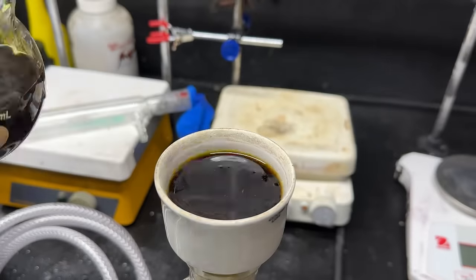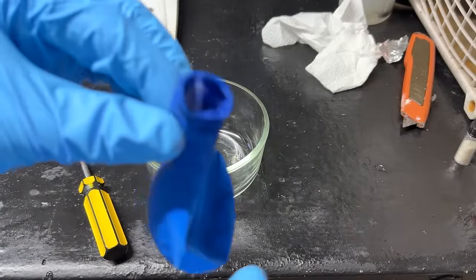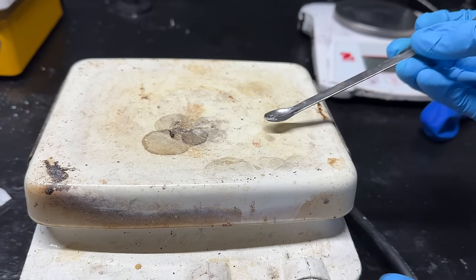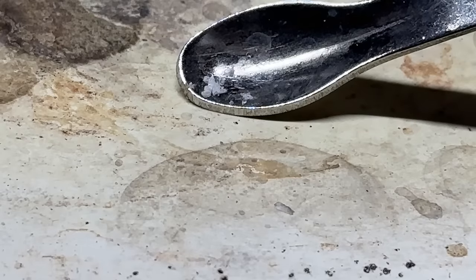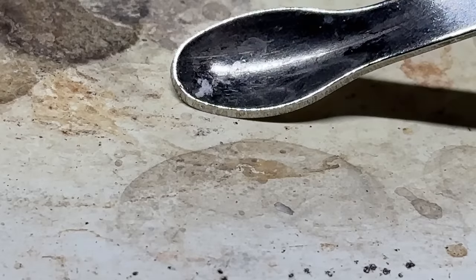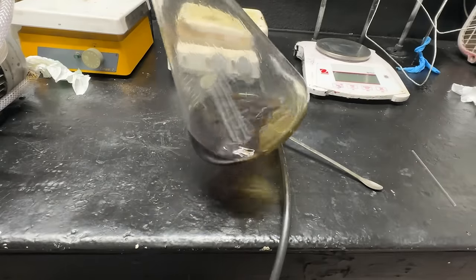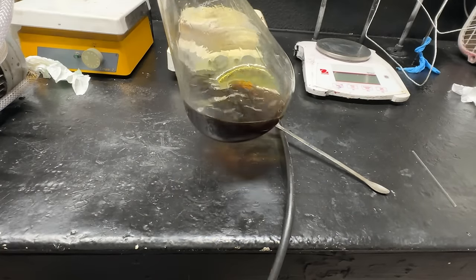The first thing we're going to do is vacuum filtrate it. While we're doing that, I'm going to collect these crystals that formed in the condenser and some that were in the balloon. This substance is weird — watch what happens when we set it on the hot plate to heat up. It doesn't melt; rather, it sublimes. You can see it just disappearing — it's not turning into a liquid. That's not histamine, so I have no earthly idea what it is. Anyway, we've got our filtrate here, though it's very tarry-looking and our flask definitely has some tar left behind.